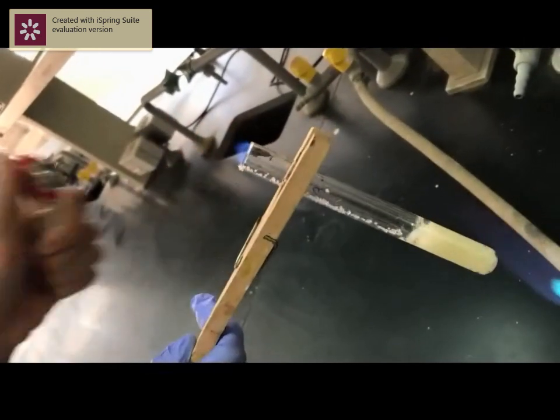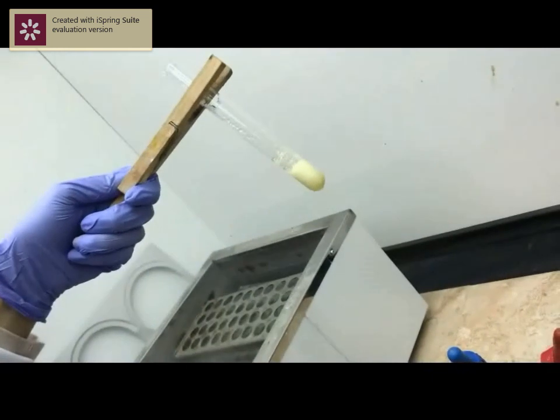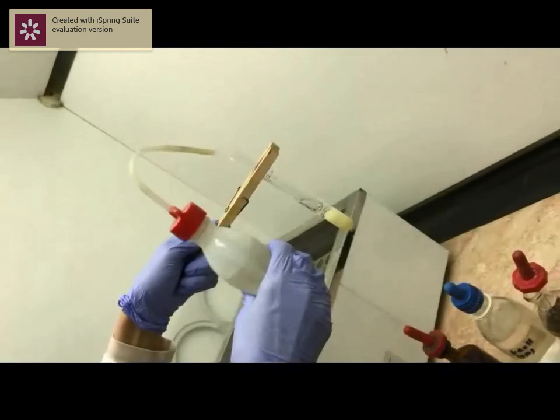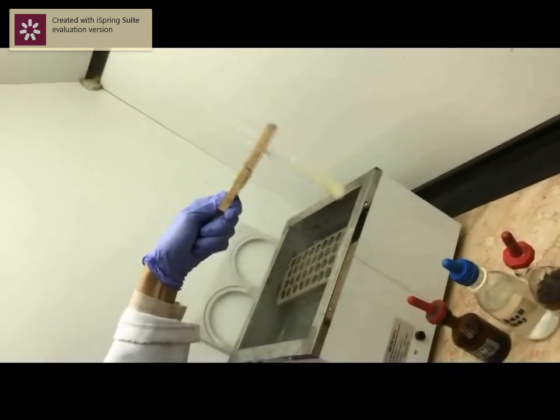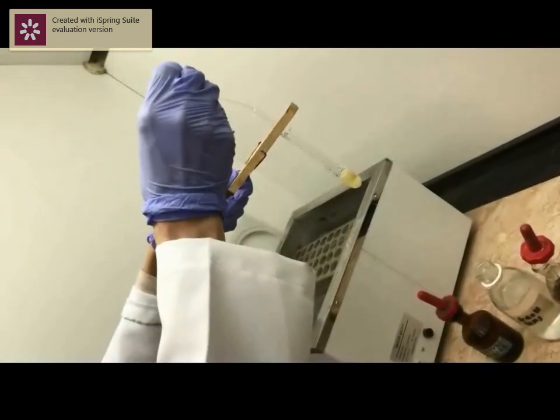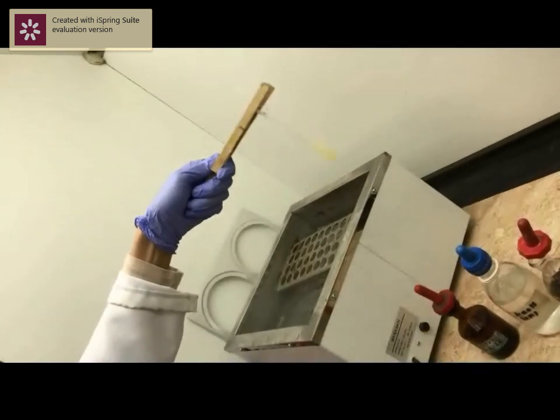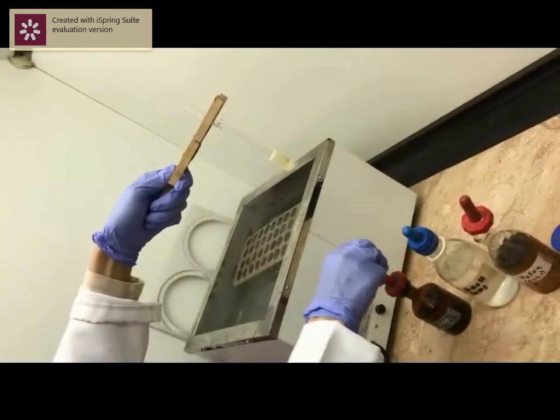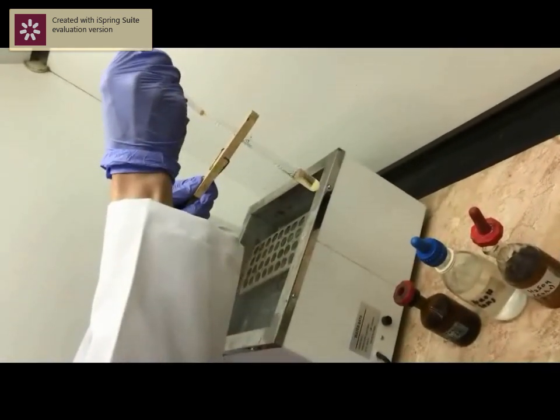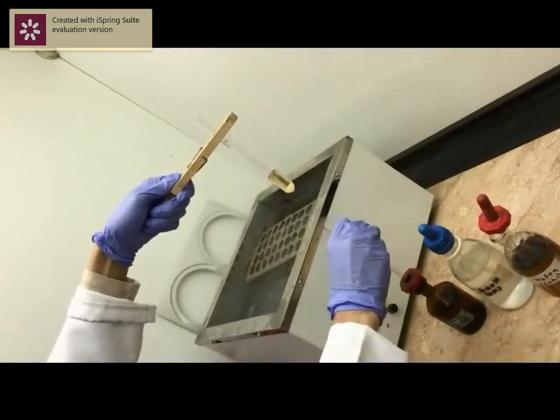Now we will see the blue flame due to carbon monoxide. After cooling, add a few ml of water to dissolve the mixture, then add sodium hydroxide to make it alkaline. Finally, add a few drops of sodium nitroprusside and note the change in color.